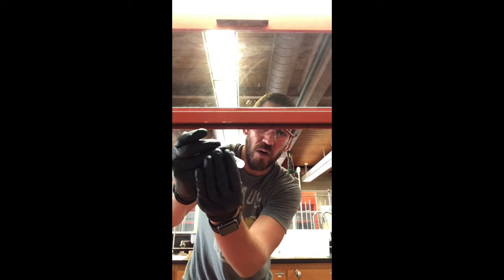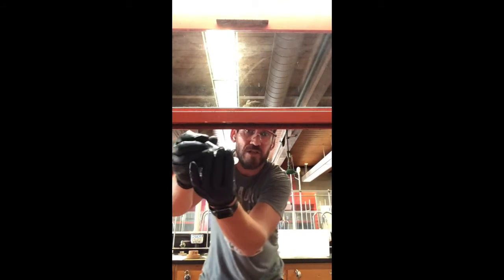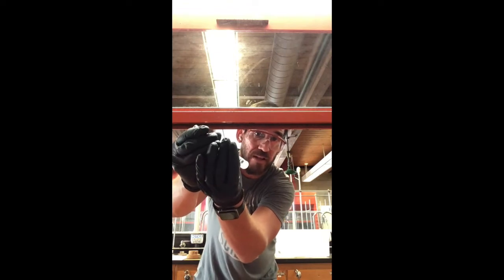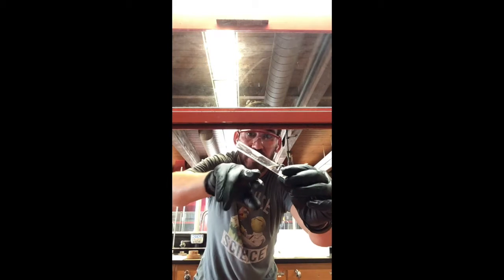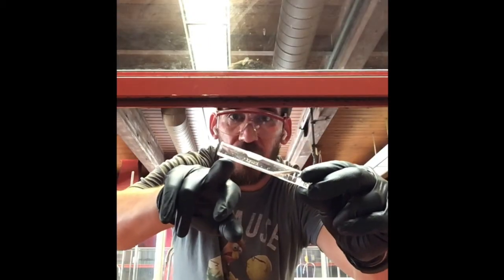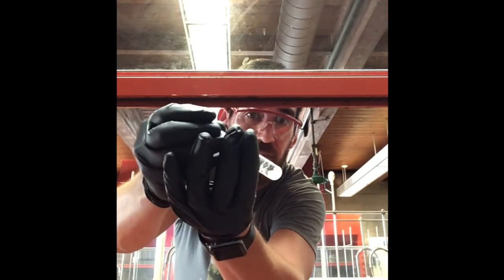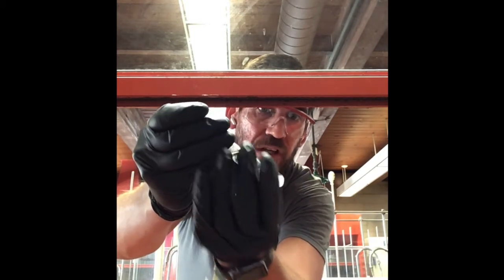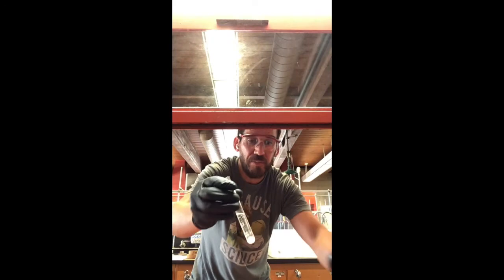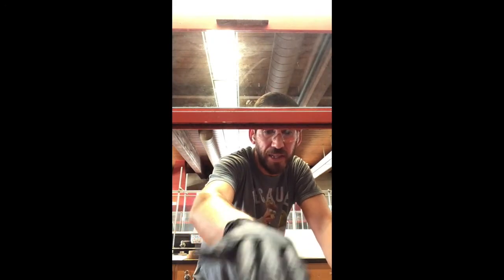And so down below, we see some individual particles just kind of tumbling around as I'm spinning this with two hands carefully. And also I'm tilting it at an angle such that this liquid is not going to fall out, okay? So tilting it at an angle that's appropriate, and then I'm also twisting, and you can see it tumbling. And so that's really what I want. And so I'm going to let that hang out.